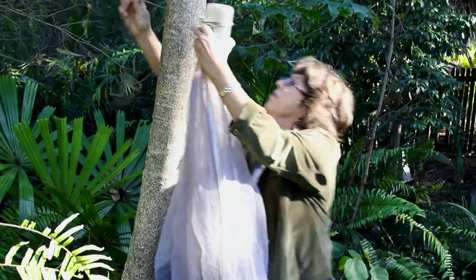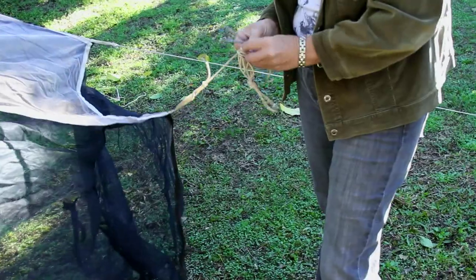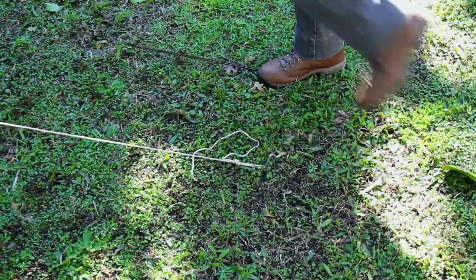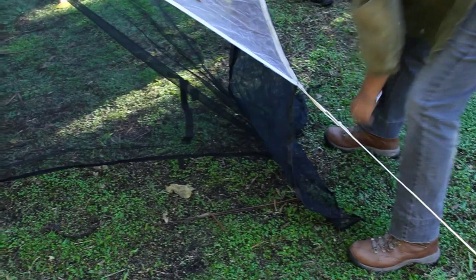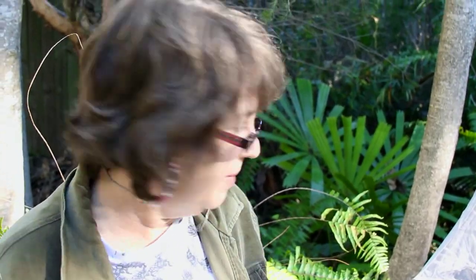The malaise trap is tied at both ends usually to vegetation and it's then tied out so that you open the trap up. The bottom is then pegged out so that it is close to the ground if not touching the ground. That means that the flying insects that are coming along the ground will also be collected in the trap.